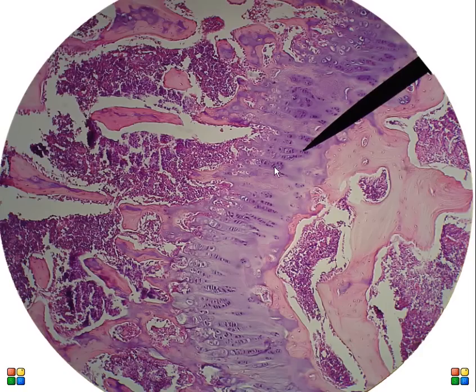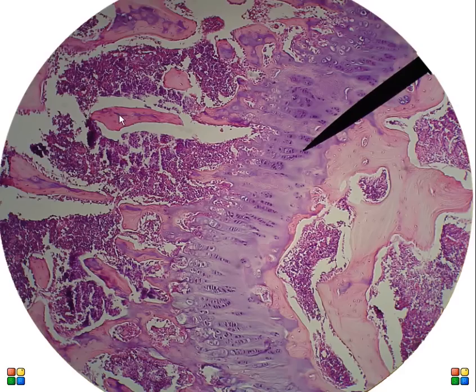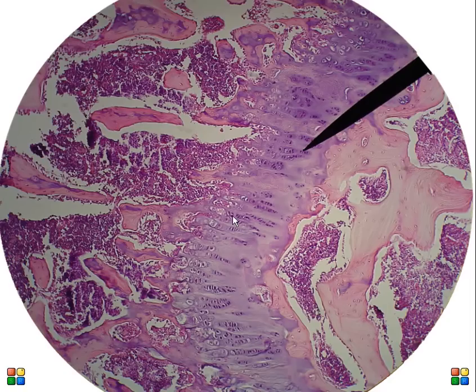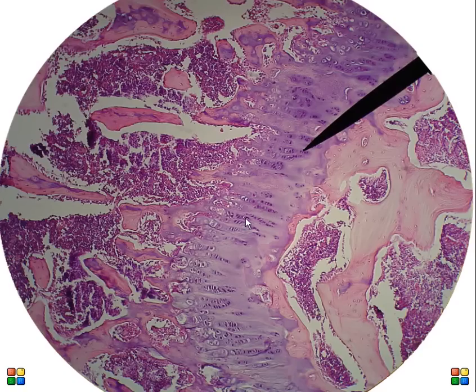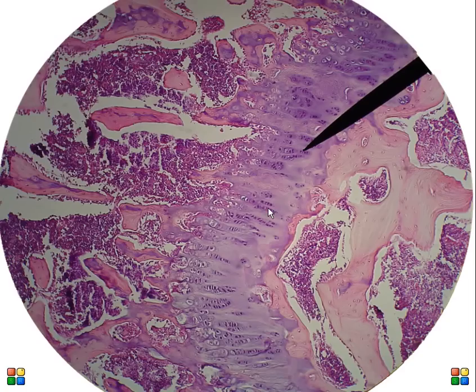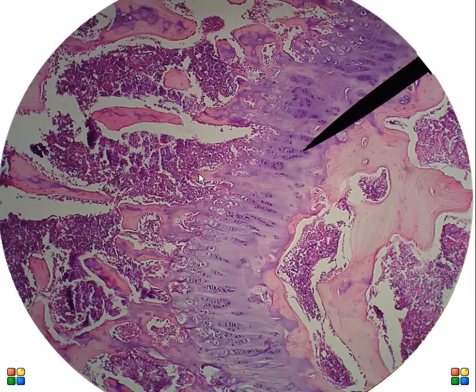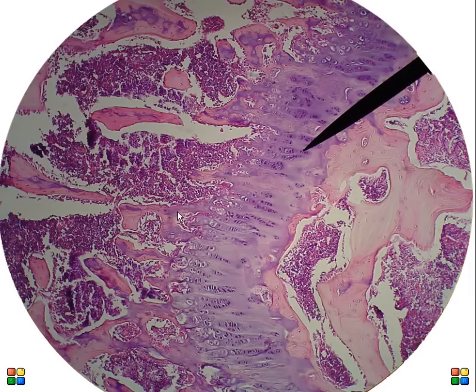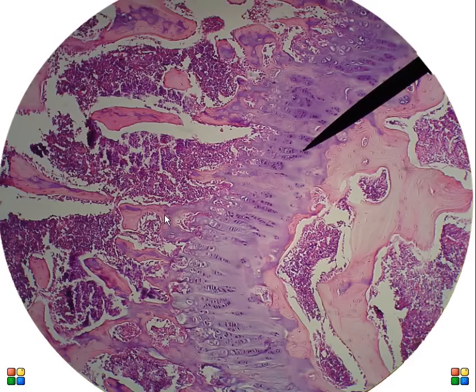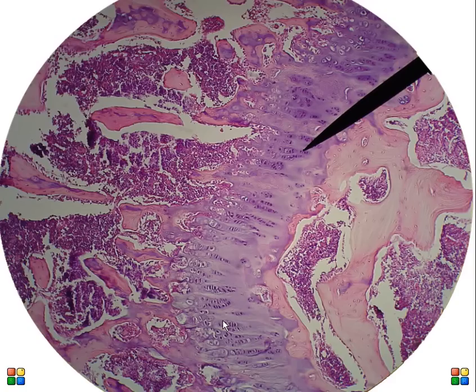Here's the growth plate at a hundred times magnification, and the spongy bone at a hundred times magnification. Inside spongy bone, the bone tissue is the lighter pink material, and the darker purple with all the dots is red bone marrow. On the growth plate we see stacks of chondrocytes. The chondrocytes are dividing on this end and pushing downward as they divide, producing hyaline cartilage. As this hyaline cartilage approaches the area of spongy bone, the chondrocytes differentiate into osteoblasts and build bone — basically converting that hyaline cartilage into hardened bone matrix. Then the osteoblasts, once surrounded by bone matrix, turn into osteocytes, the mature bone cell.